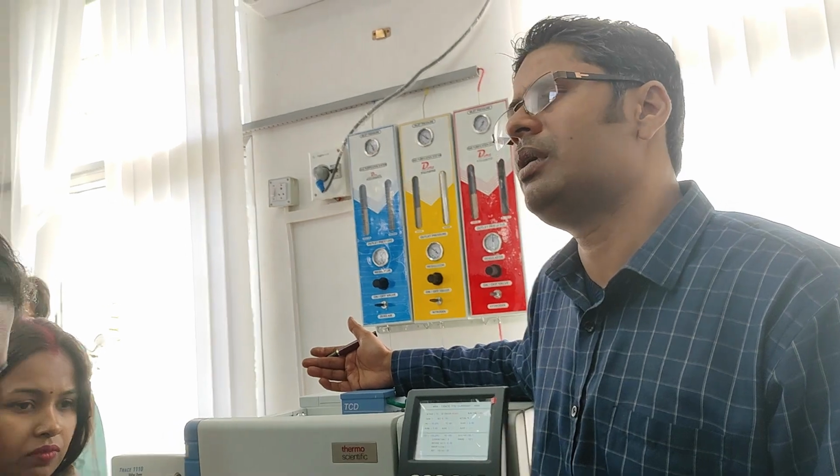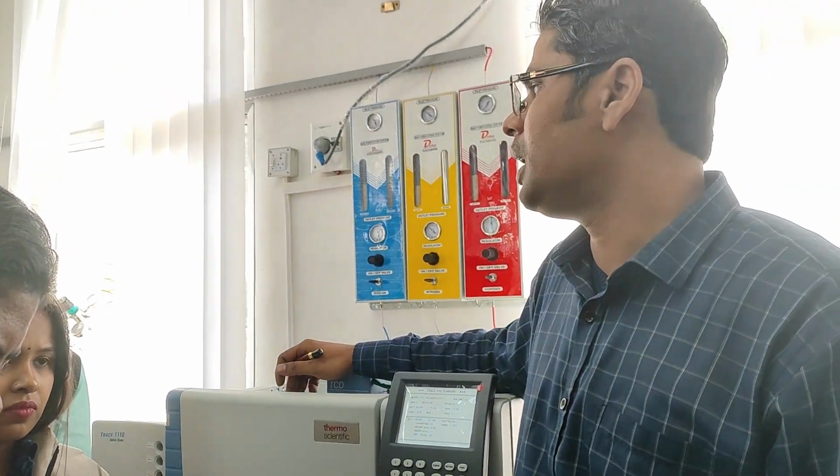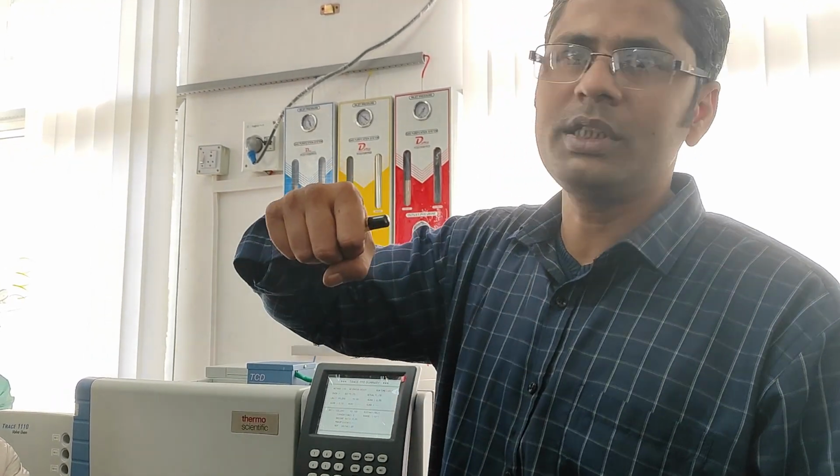Because GC is a very vast application instrument. So many institutes and industries use GC for different applications, like transformers, power sector, power plants. There is insulating oil inside a big transformer. They regularly check the health of the transformer by extracting the gases dissolved in the insulating liquid. That oil is taken from the transformer into a gas extraction apparatus, and the dissolved gas is extracted and injected into the GC to check whether acetylene or hydrogen are there.